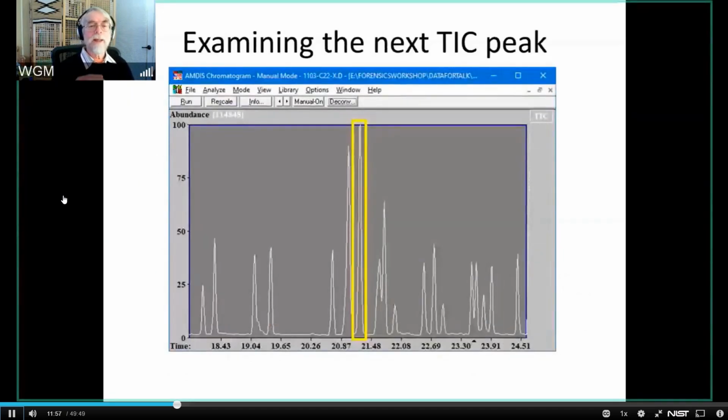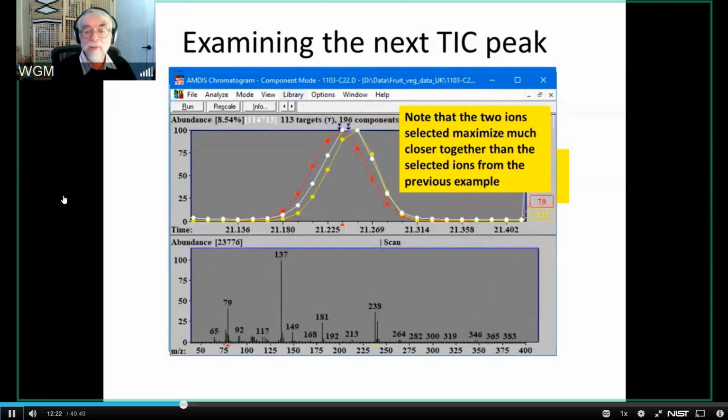Now, I'm going to go back to that chromatogram that I showed you, and I'm going to look at the next peak and again examine some of the things that happen within the data file when we start looking at what looks to be a little bit more complex data. And when I blow this one up and look at some selected ion chromatograms, I've got two ions here, 79 and 238, and here's the raw data. I'm taking the raw data at this point. So you see that I'm looking at this 79 ion, and I'm looking at this 238 ion. We'll see that they're different, but they're also of comparable size, and it's a lot easier to see what's going on. And what you see here is that one of these ions appear to peak on successive scans.